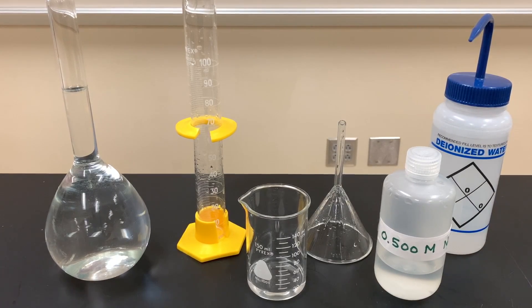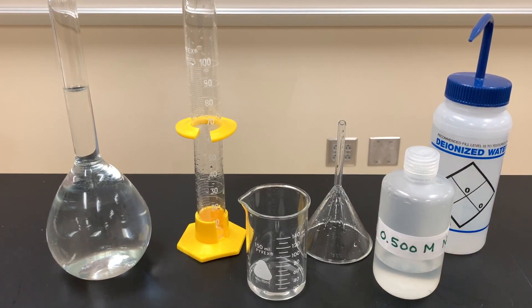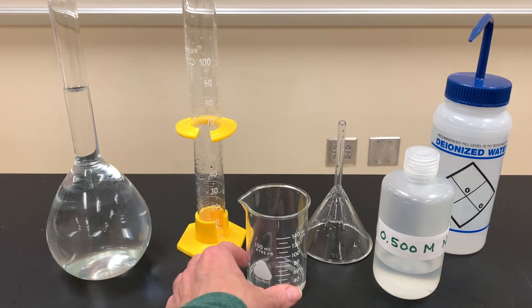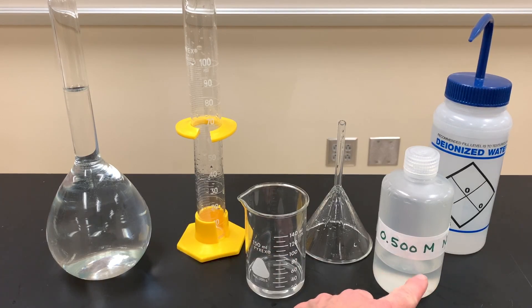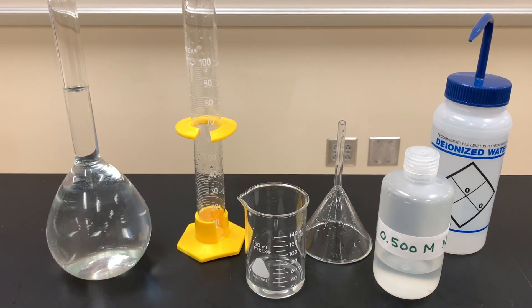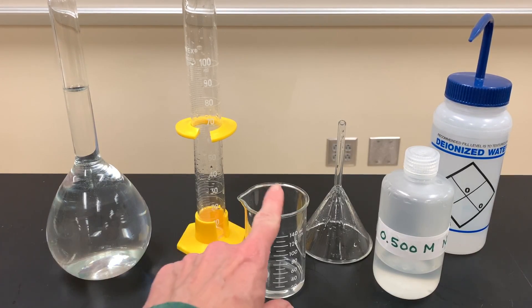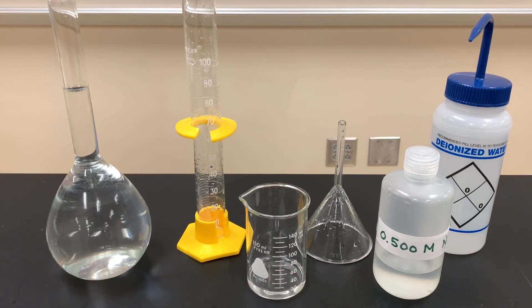When finished, transfer your solution to a properly labeled stock bottle. Clean and dry all your glassware and put it away. Never put any excess stock solution back into the original reagent container — either dispose of it down the drain if it's safe, like salt water, or place it in a waste container.